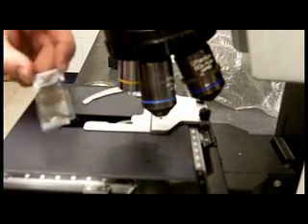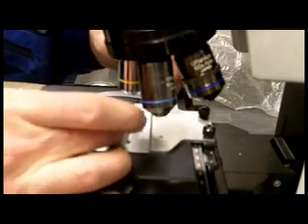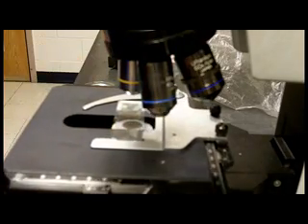If you noticed, the tape extends over the edge of the microscope slide. Peel that off so it doesn't get caught when moving the microscope slide around the microscope stage.